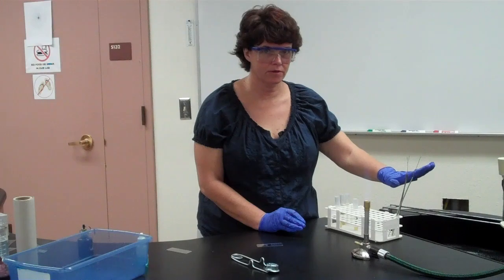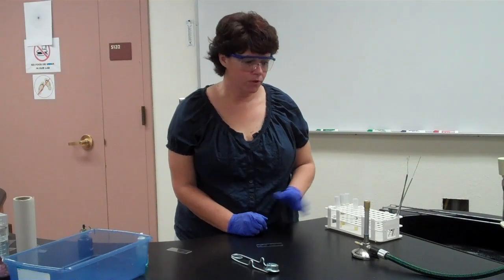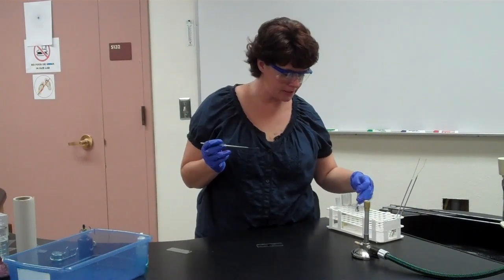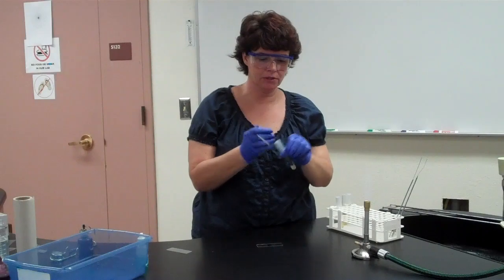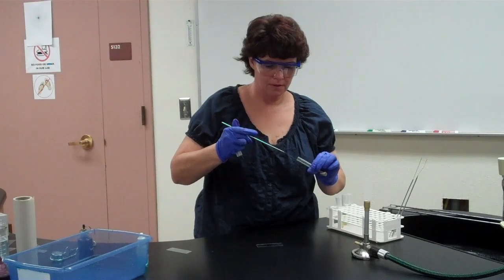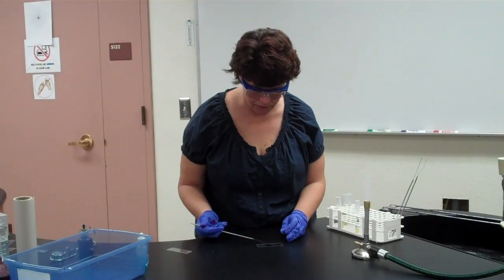Set the loops off to the side to cool. There are lots of different bacteria that form capsules — we'll use a couple of different ones; there may be a change in your lab manual due to the fact that we don't have all the bacteria available. Once the loops are cool I'll grab one at a time. Remember you can hold the glass and tap it to get a whirlpool going to ensure a good sample, grabbing the tube with your pinky, running the loop through the hottest part of the flame, then going in to grab a loopful. I've done my first loopful.